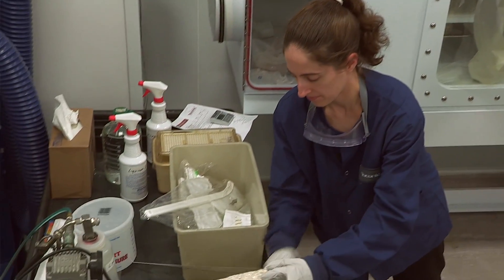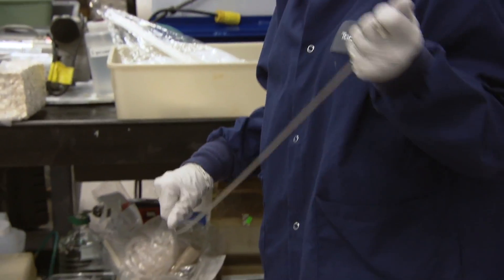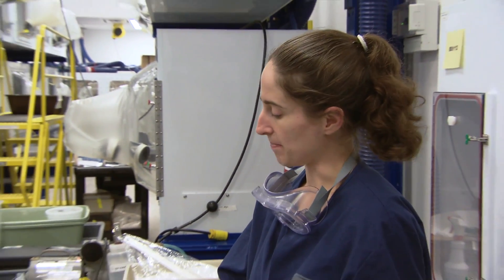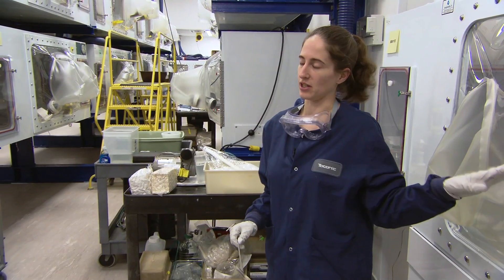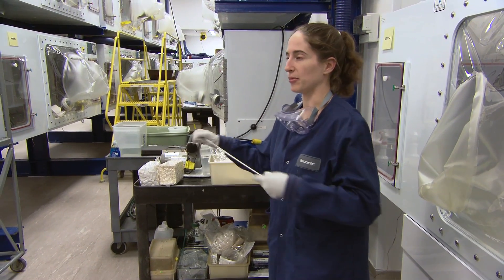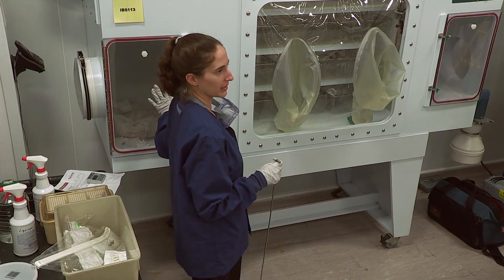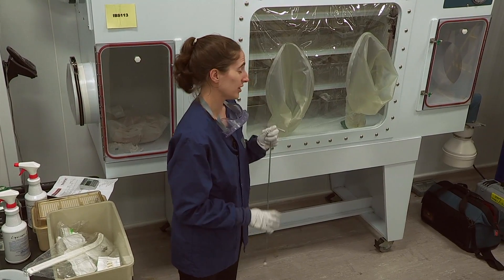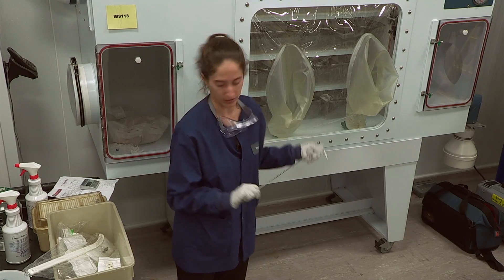One thing that is very useful, especially if you have petite people working in your facility, is some kind of hook. These are easily autoclavable and can be packaged in a breather bag. We hand spray them or usually put them in the isolator before setup during sterilization. When you have the port full of everything you need for two weeks, it can be difficult to reach to the back. A hook is also very useful if you have larger isolators for rats.